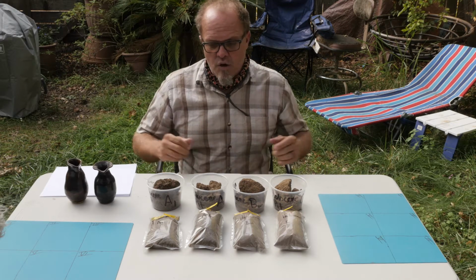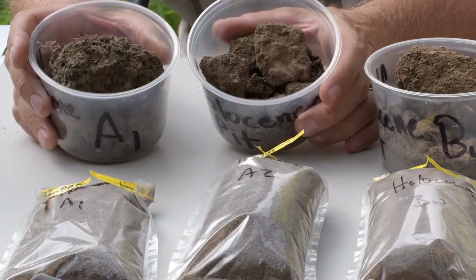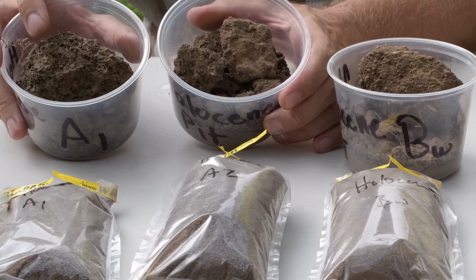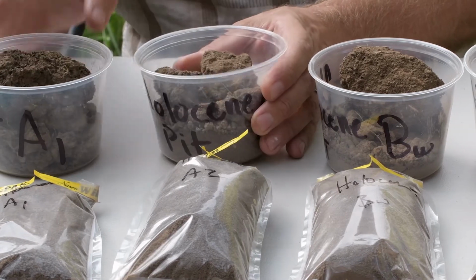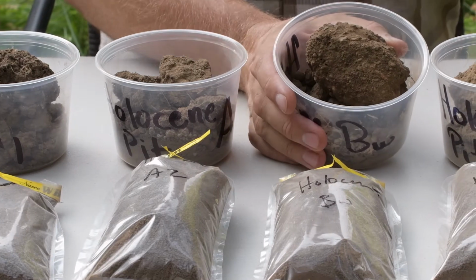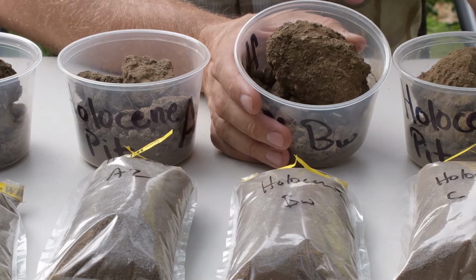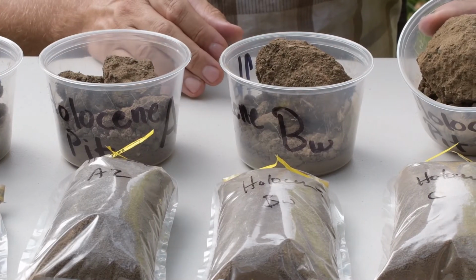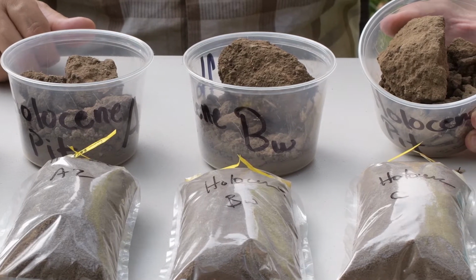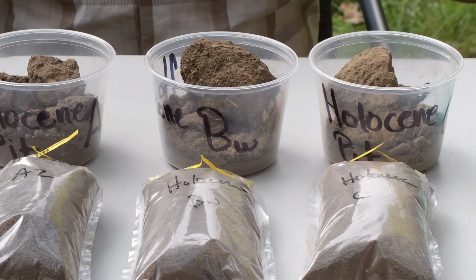So if you remember, we had a couple of nice dark A horizons here in the surface, and even between those you can see the difference in the structure, with the granular structure and the bigger subangulars, and a change in color. Getting down into those subsurface horizons, remember we talked about the zone of accumulation, the B horizon, and then into the C horizon, stuff that is sandier and more like the parent material that was deposited by Butte Creek sometime in the past. So why do we do this?